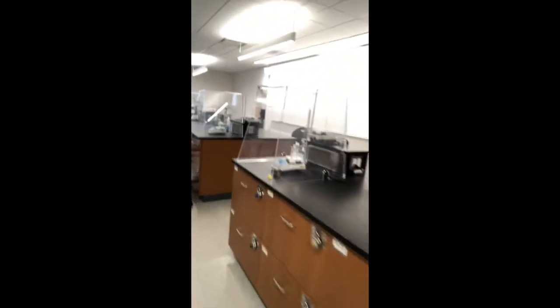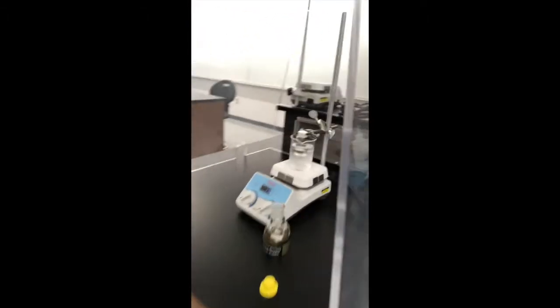They're all blinking because their heat is not on, but it's just detecting the cold temperature of the ice bath, and for some reason that's making it blink. But all right, anyway, I'm going to get just the video showing me adding these, and then that'll be it for a little while.